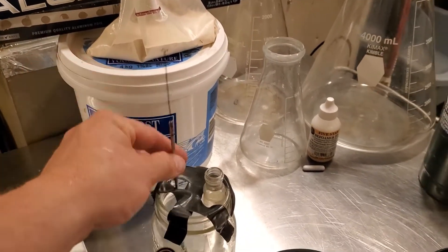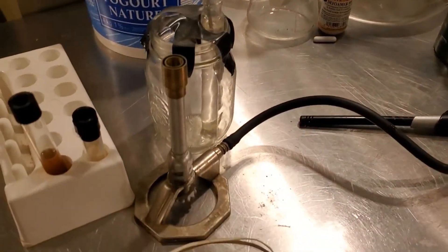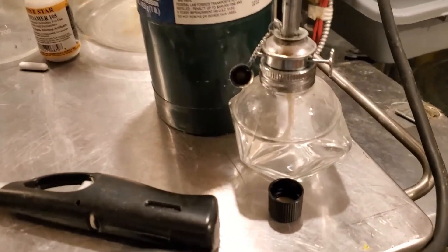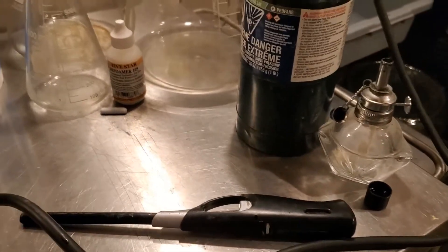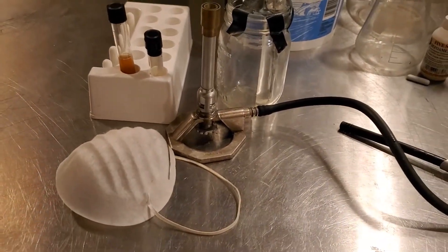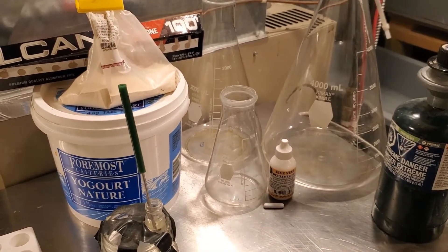You're going to need a way to inoculate, so I've got my inoculation loop here, purchased at a lab supply store. I like to soak that in some isopropyl alcohol — I'll just leave that inverted in there. You need a way to sterilize the loop and vials, and also to create an updraft. For that I like to use a Bunsen burner. You could also use an alcohol lamp, but you don't get nearly the amount of flame or updraft, and it takes quite a bit longer to get the loop really nice and hot. I'm also going to wear a mask so I'm not breathing bacteria into the setup.